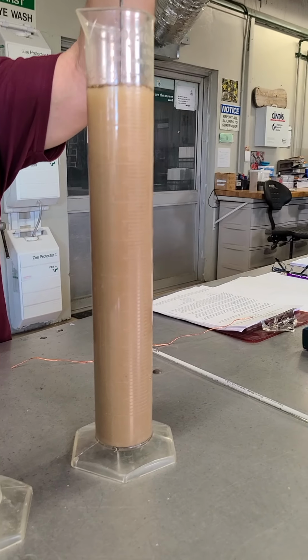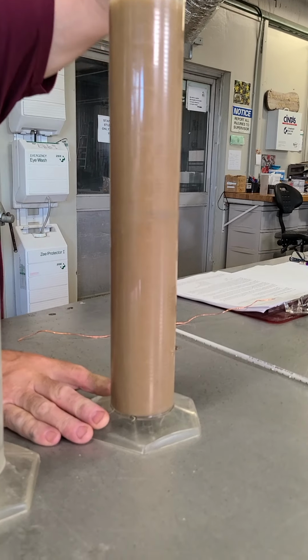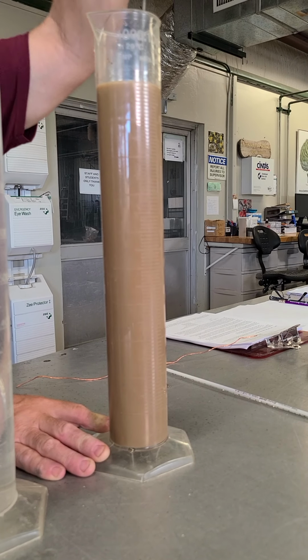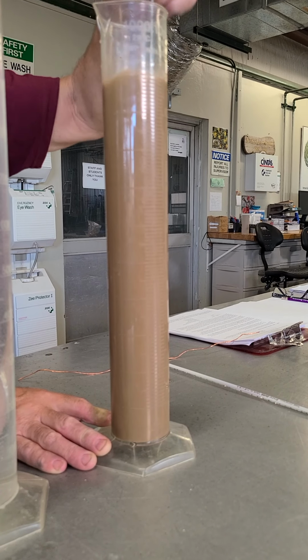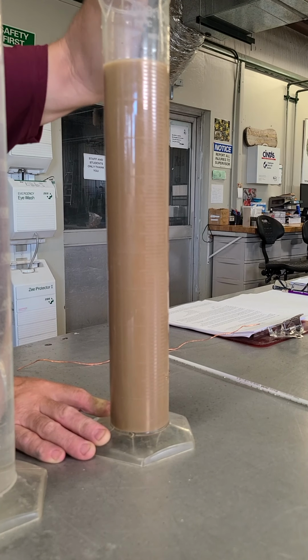So I'm going to twist this left and right, and bring it up and down. Sometimes it's better to hold the base of this, if you get too exuberant. I'm going to be careful. This is where people spill things out the top a lot. You don't need to go all the way up to the top because you're generating enough force. If you just go about halfway up the cylinder, you'll get everything into suspension.